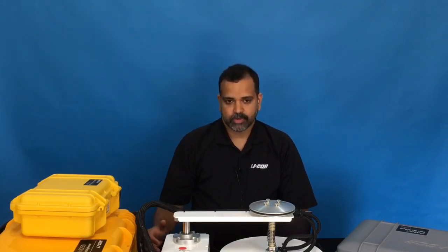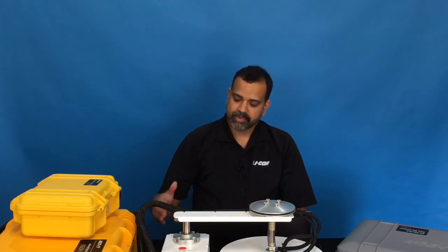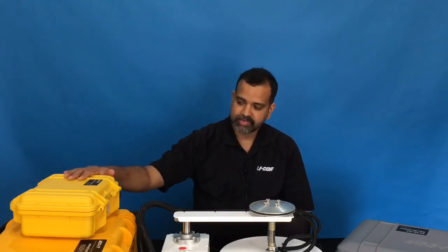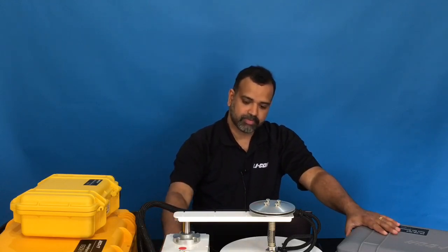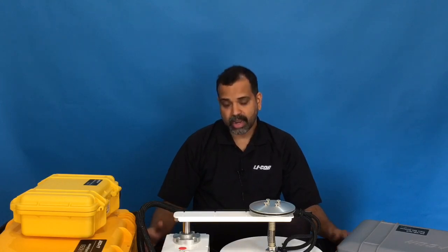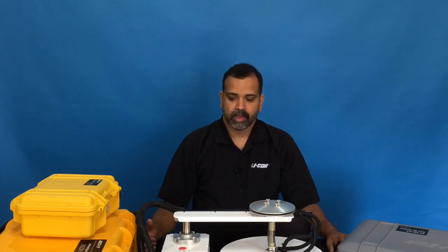So today I'm going to talk about how to set up a basic measurement with an 8250 system. Here I have an 8250 system with two gas analyzers. I have an 870 on my right side and a 7810 on my left side, and I have one long-term chamber with me here. We will do the initial setup in the lab, and then we will go out and do a simple measurement out in the field.